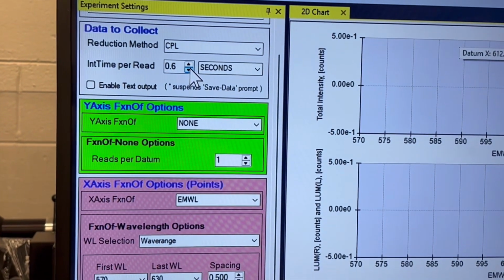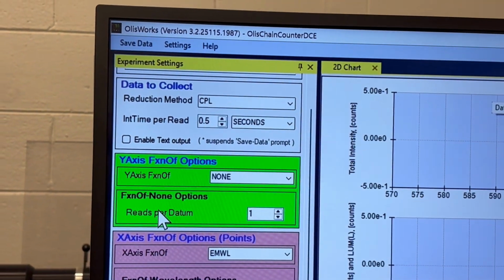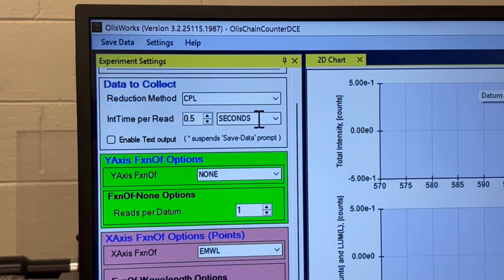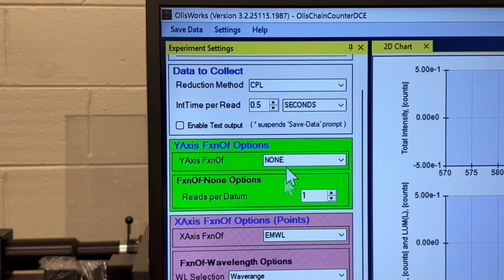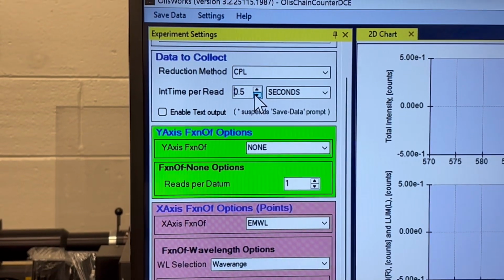Okay. Now, below that, if you're working with very, very small signals, would you change that not only to seconds, but to minutes, presumably? Yeah, but I know it's always seconds. The way we extend time is to say a half a second is one read of the signal.